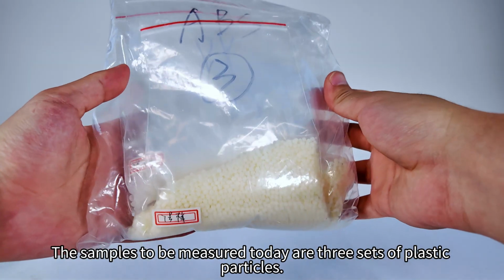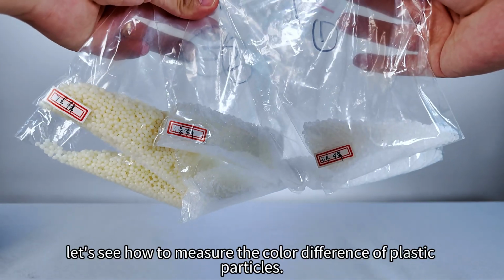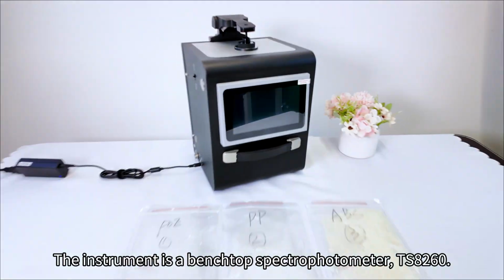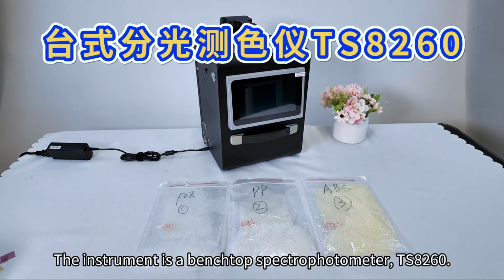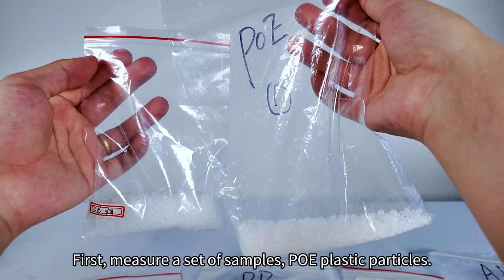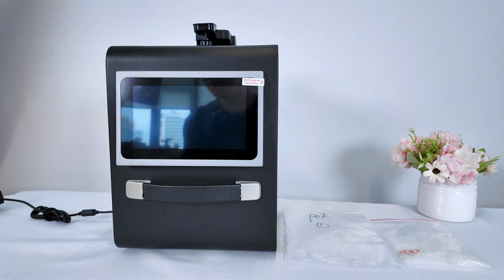The samples to be measured today are 3 sets of plastic particles. Let's see how to measure the color difference of plastic particles. The instrument is a benchtop spectrophotometer, TS8260. First, measure a set of samples, POE plastic particles.